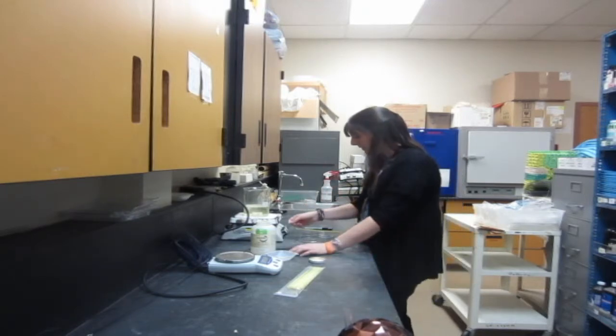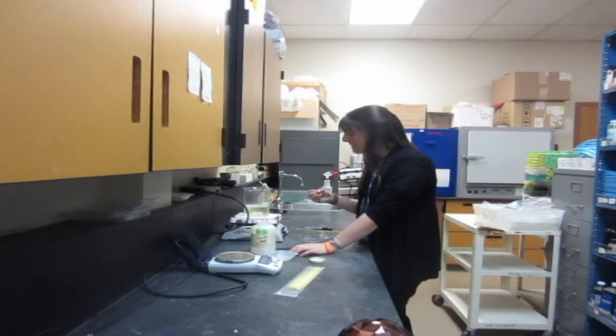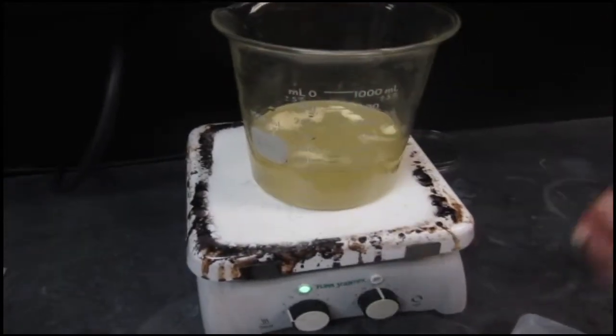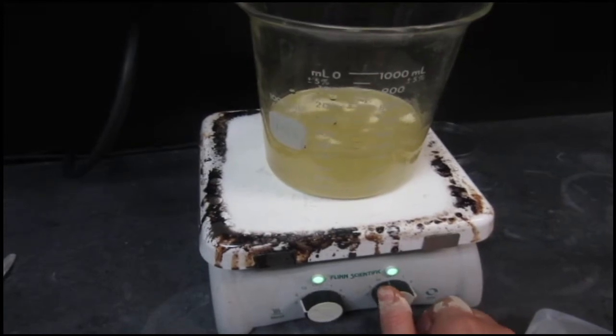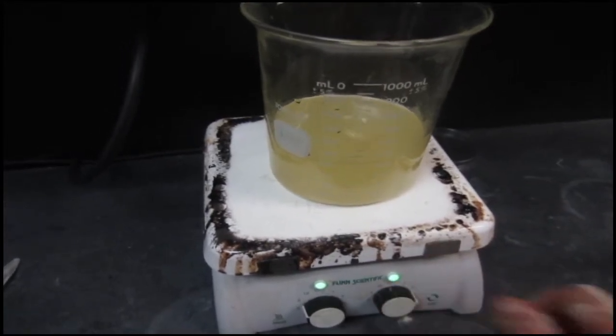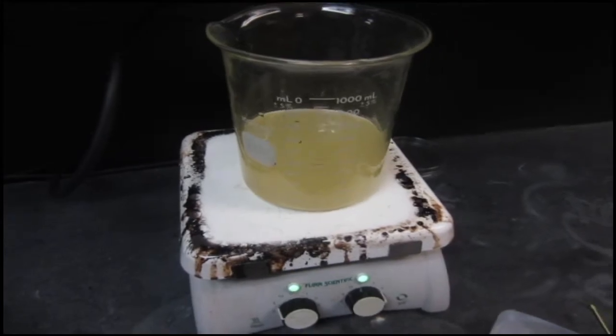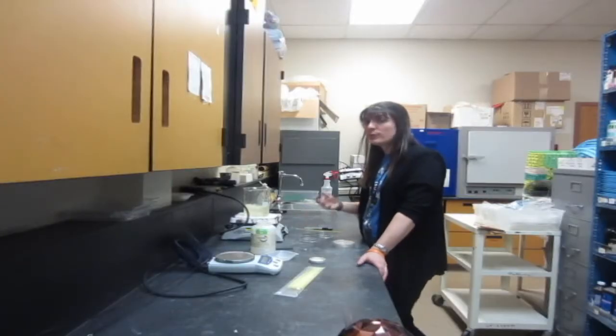The other cool thing about this is we have access to these magnets. I can take a magnet and stick it in, and then I can turn this on to the stir function. That stir function will stir my agar the whole time so that I don't have to, which is really nice. Then I'm just going to wait until the agar gets to the boiling point.